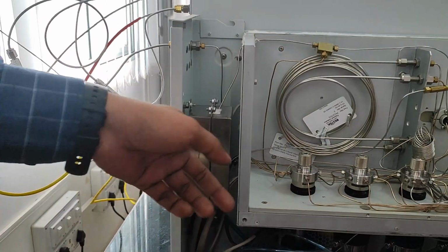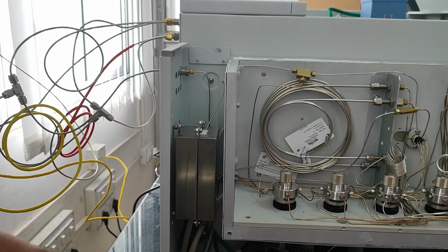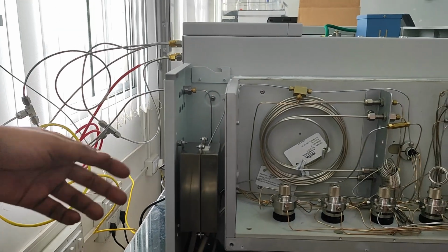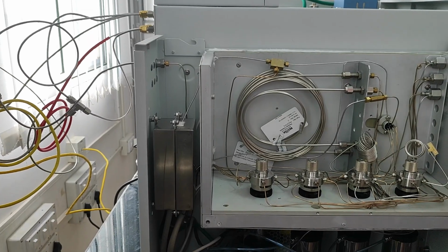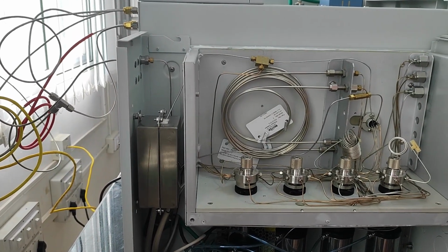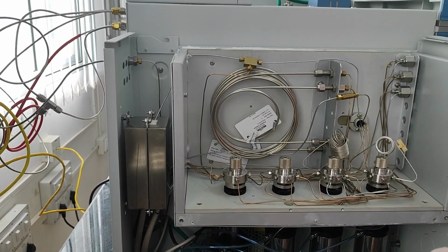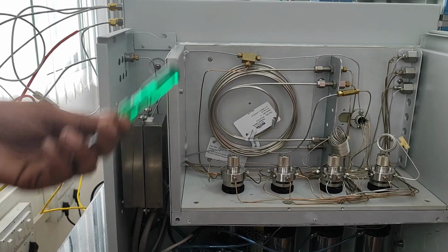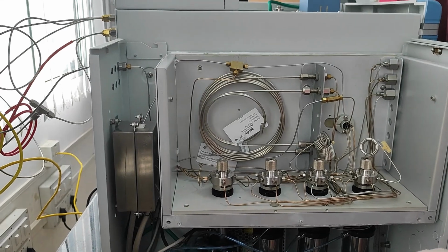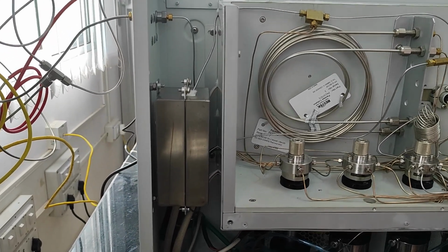Inside there is one tube containing nickel catalyst, and also we are giving hydrogen. Without the presence of hydrogen, it is not possible to convert CO and CO2 to methane. At the same time, it will also produce H2O, water. That water will go to the FID, and there will be no peak, no effect.